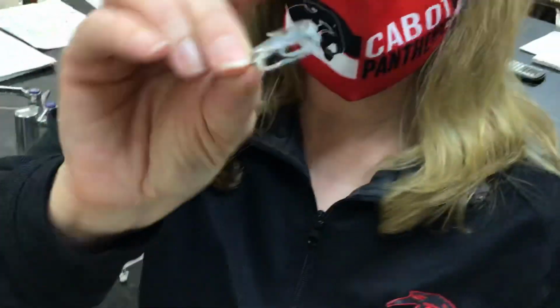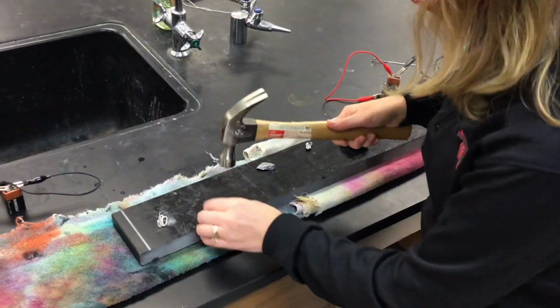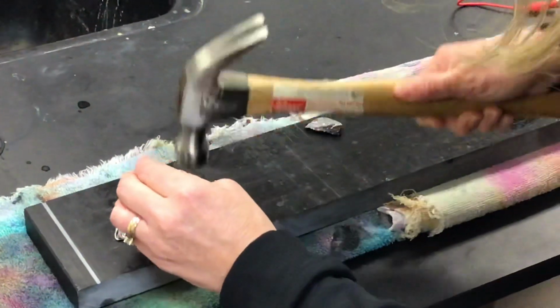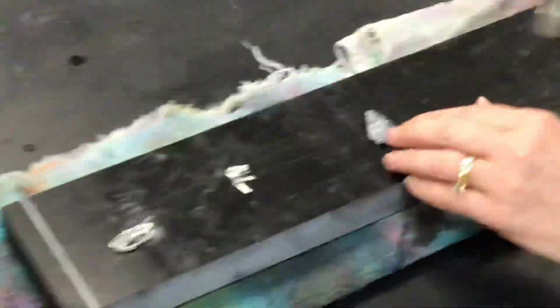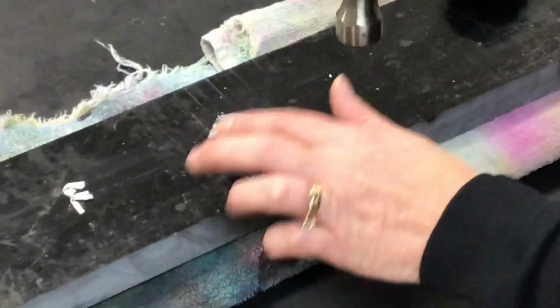All right, so we're going to start with our aluminum again. As you can see, is it malleable? Did it flatten? Next, we're going to look at magnesium ribbon. Did the magnesium ribbon flatten? Is it malleable? Alright, what happened to the silicon? Didn't flatten, what did it do? Tell me what it did.